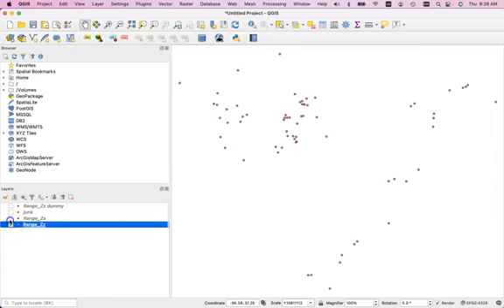If you look at Dan's smaller list of points, so here's all of his points, and here's the smaller list. When he used a smaller list, not with the dummy geography, but with the real geography, but where he randomly took out half, notice that a bunch of these points here at the extreme are gone. So a bunch of the points up here at the extreme are gone. A point over here at the extreme is gone. I suspect that that means that there's less of this extreme geometry in these triangles, such that we don't have any of the lengths of any of these triangles that are being calculated being rounded down to 0.